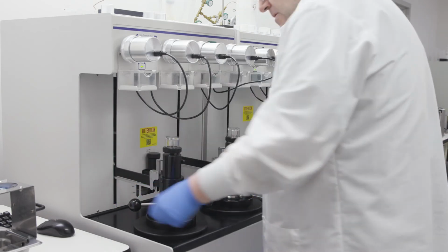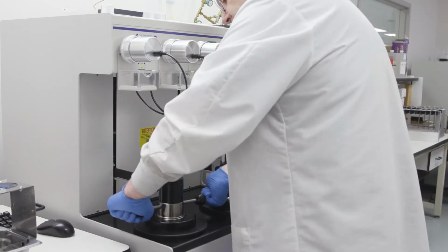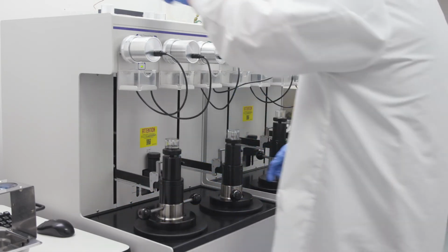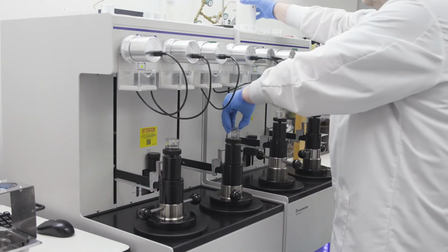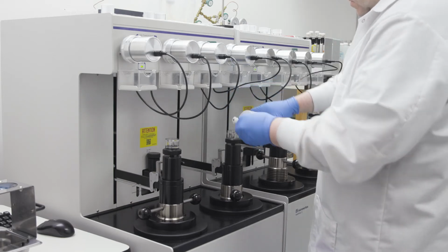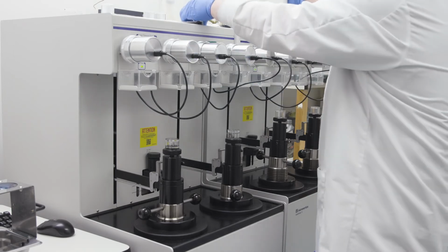As Chris closes the left port, some high-pressure fluid can be seen entering the vent valve reservoir. We do not see any yet on the right side. That is because the penetrometer occupies some space in the left chamber, but the right one is empty. Chris will add some high-pressure fluid to the right vent reservoir.